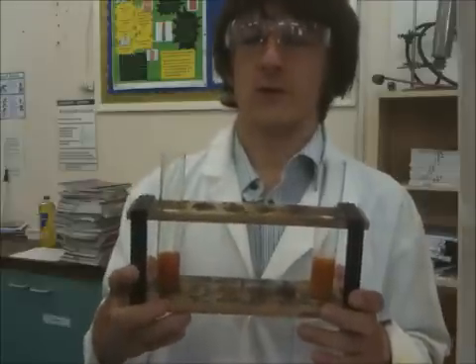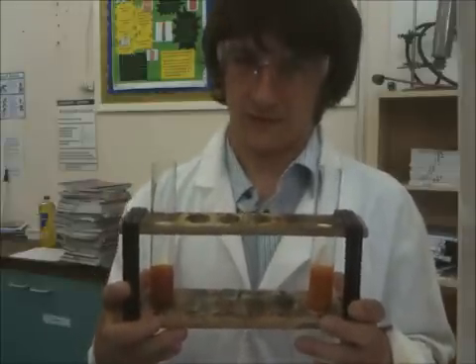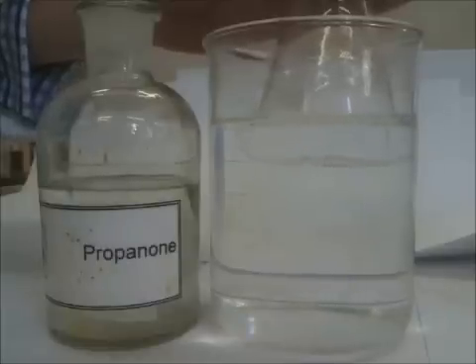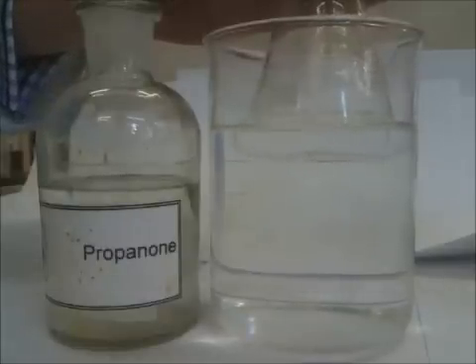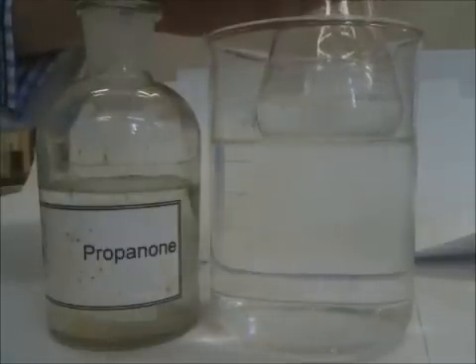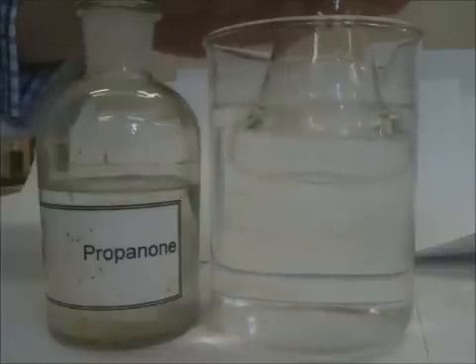But these would take too long, so we're just going to do some simple specific tests to identify which one is which. This is Tollens reagent containing silver ions. We're going to add some propanone. Nothing has happened.